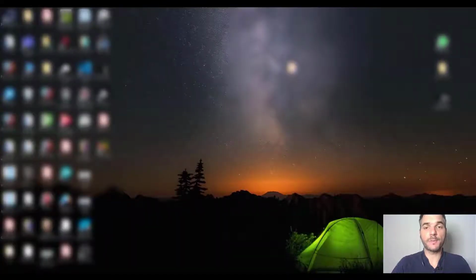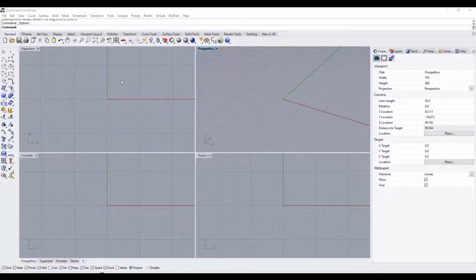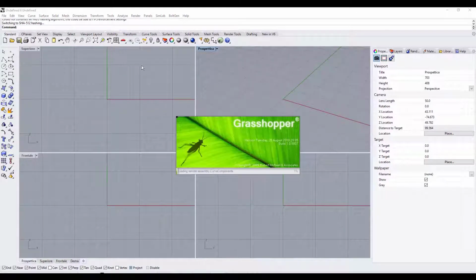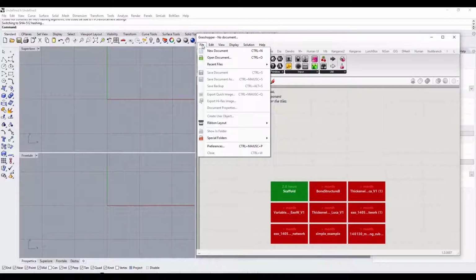Okay, now let's open Rhinoceros. We click on the Tools option and select Units, and we select Millimeters with an absolute tolerance of 0.001. Click OK. Then we write Grasshopper at the top of the screen. Okay, now we can create a new Grasshopper file by clicking on New Document.